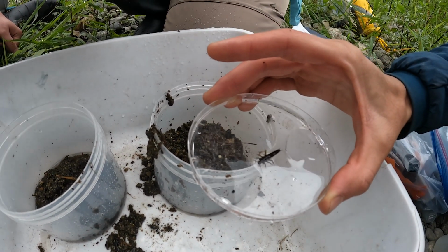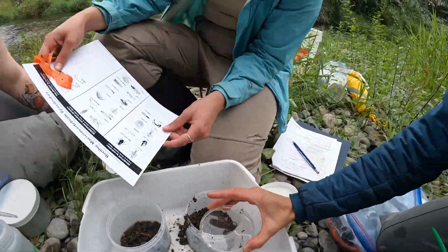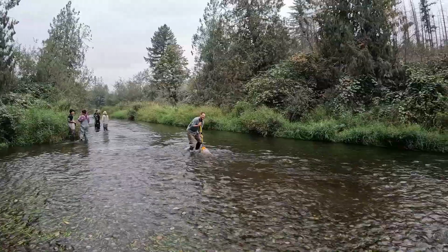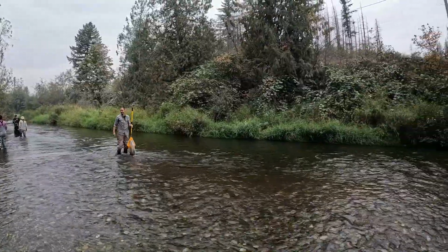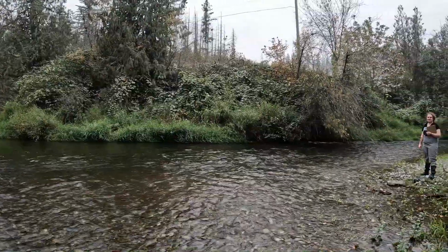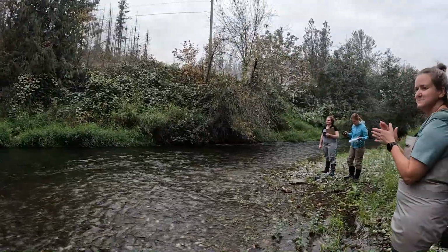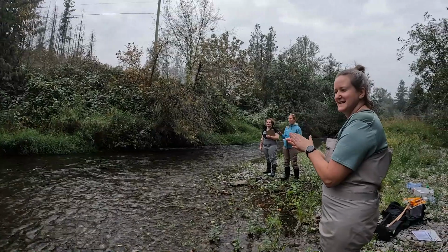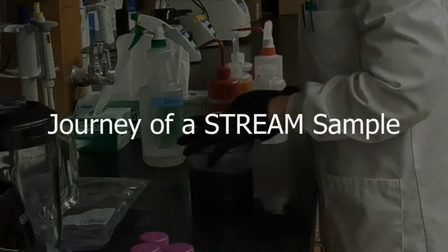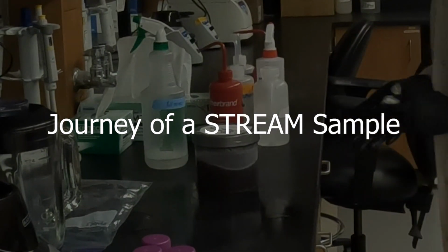We use a tool called environmental DNA metabarcoding to produce tens of thousands of usable DNA sequences from KickNet samples collected by community groups. We match these sequences to a corresponding reference sequence stored in international databases. Let's follow the journey of a stream sample as it transforms into watershed data.